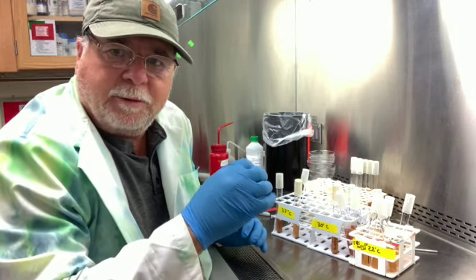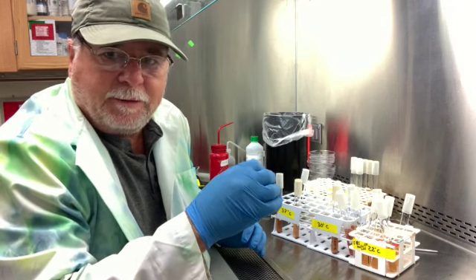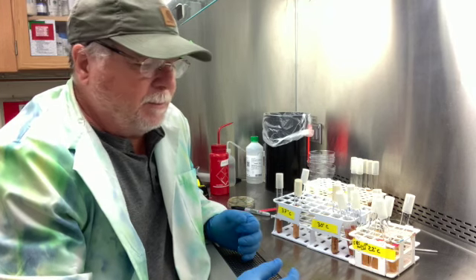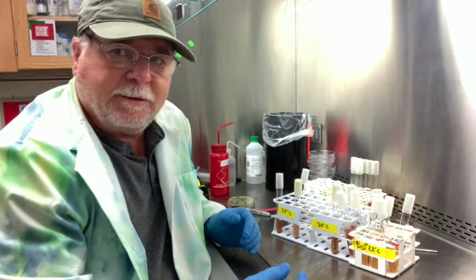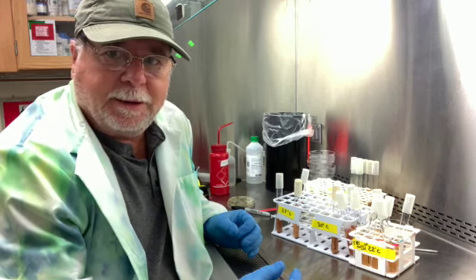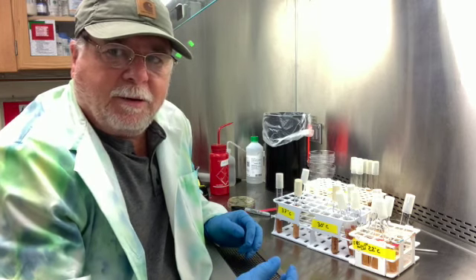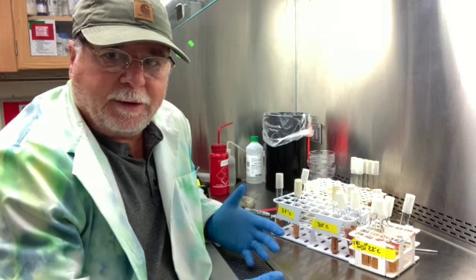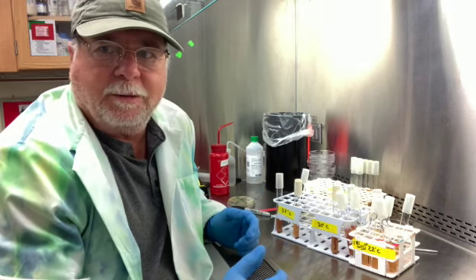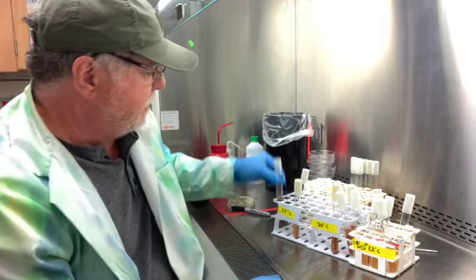Is it growing near the surface only, or is it growing better at the surface, but it also grows fairly well down deep? Okay, if it's growing in both places, a little bit better at the surface area, then that's called a facultative anaerobe. And if it only grows in the surface area, that is called an aerobe, so it requires oxygen, whereas the facultative anaerobe doesn't care either way. It can grow with oxygen, without oxygen, but it grows better with oxygen. All right, so let's look at the results.